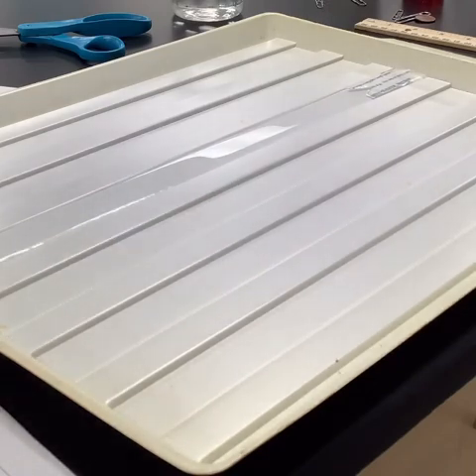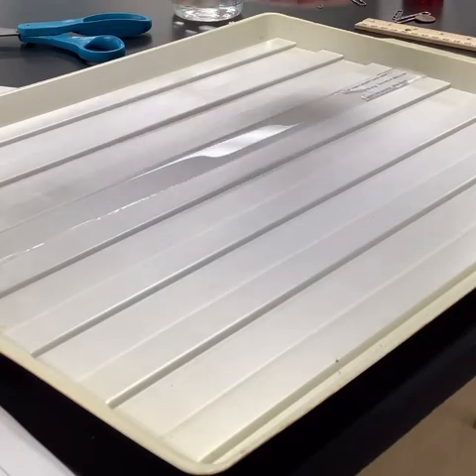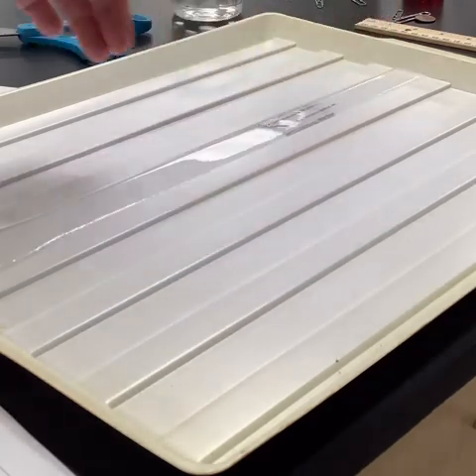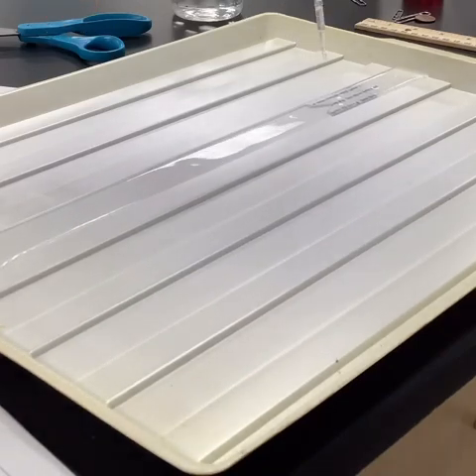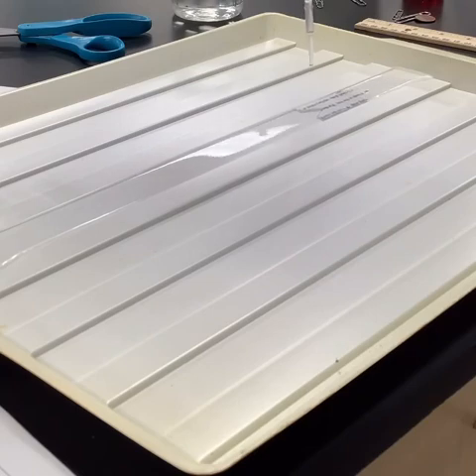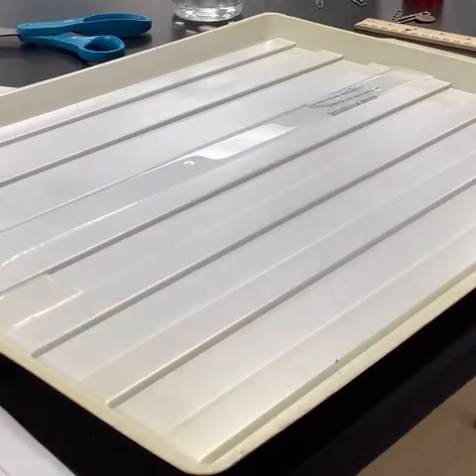There we go. Now, if we try to do it some more, if we move this guy back, you'll notice that it doesn't work. Well, a little bit. All right, not so much though. It only works that first time. Once it's traveled the length, it doesn't work anymore. It doesn't really want to move.